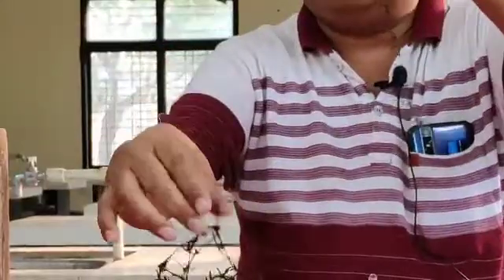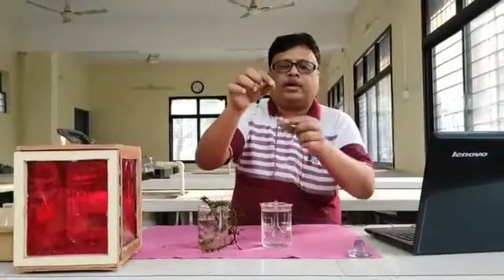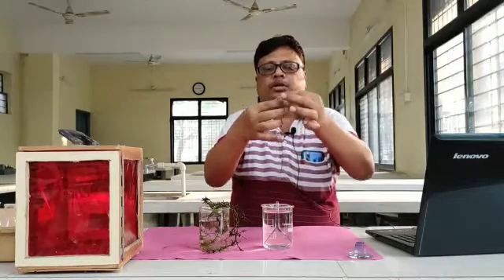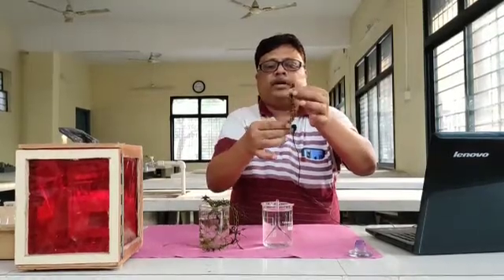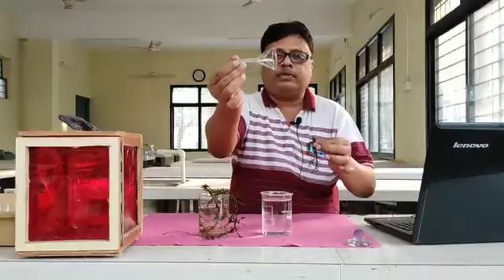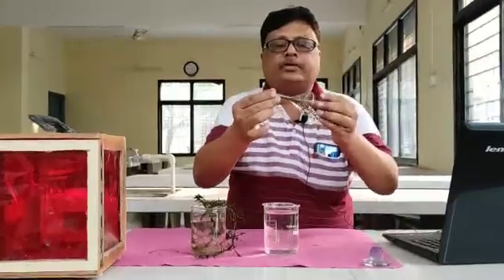I will take one of the branches of this hydrilla. It is submerged under the water and it is also a rooted one. Just take two or three twigs of this hydrilla plant like this. After taking the hydrilla, take one beaker and one small funnel, and insert the hydrilla twigs into the inverted funnel.